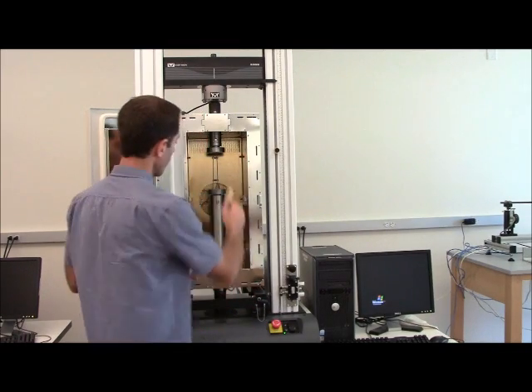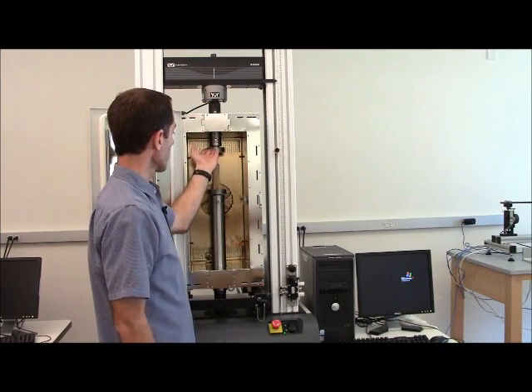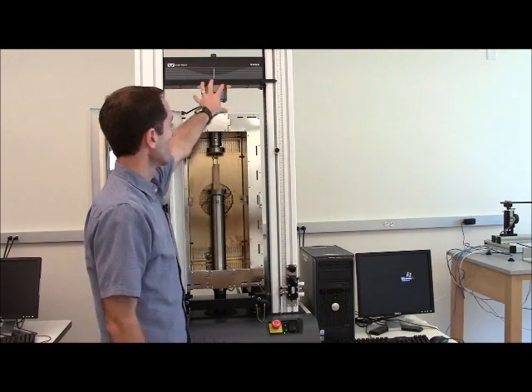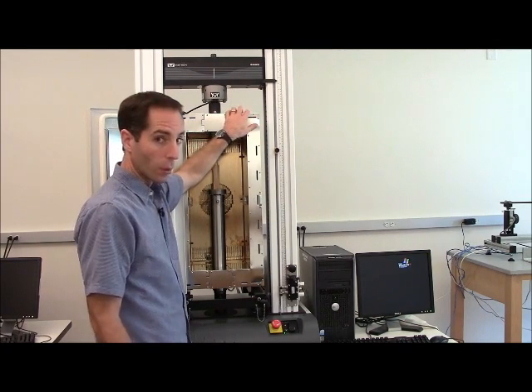In order to test the samples that we do for the compression lab, the wood and the PVC, we've got a slight issue in that for example with the wood I've got a space in here that is greater than the amount of clearance up at the top of the system. So if I were to bring this head or try to bring this down we would crash into the load cell and the pin may crash down into the top of the oven before we get to it.